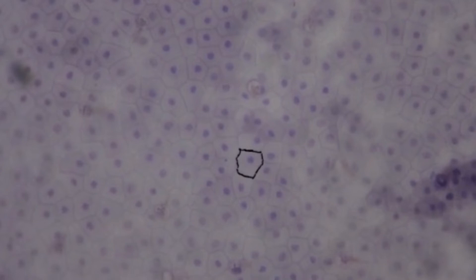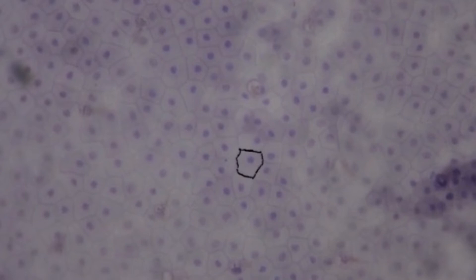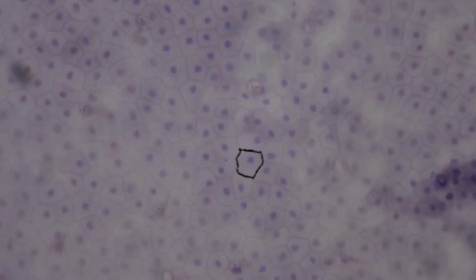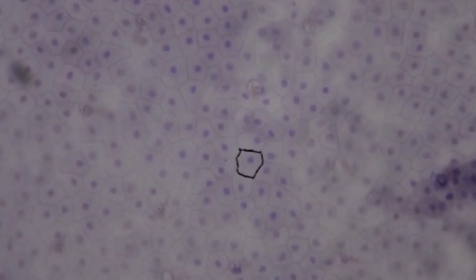However, you can infer the simple squamous by looking at the top of the cells. First, notice that there are no nuclei stacked on top of each other — there's only one layer of nuclei, meaning it's simple. Also look how transparent these cells are, because the cells are so thin that light can easily get through. You'll have to use your imagination and pretend you could cut the skin in half and look at the sides of the cells to really see that simple squamous.